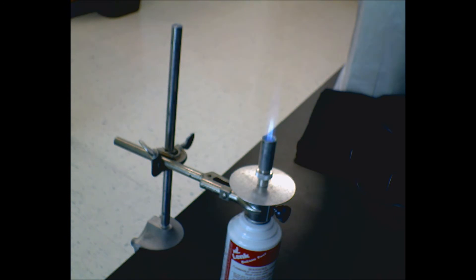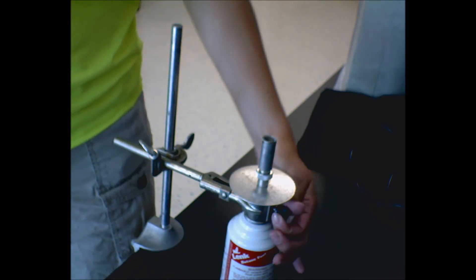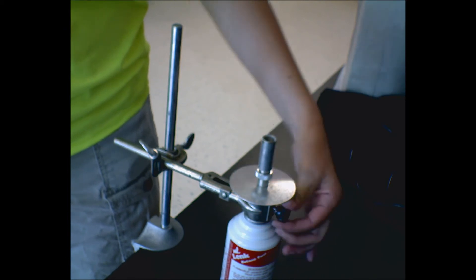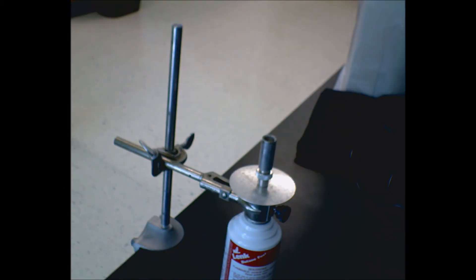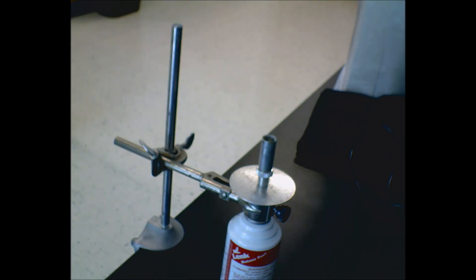Now to turn it off, all you've got to do is turn this knob, you know, righty-tighty-lefty-loosey. Make sure it is well sealed off. I'm going to reset it so the holes are covered.